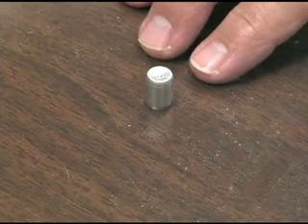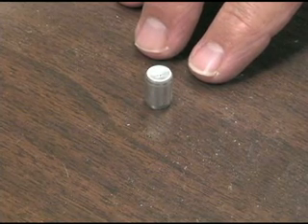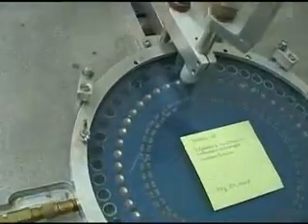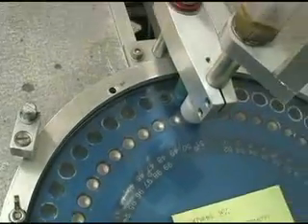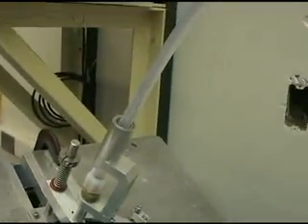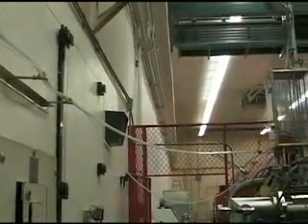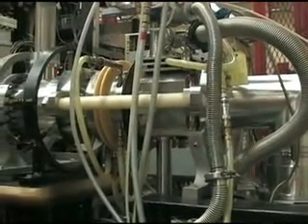We have now pounded the Beryllium-10 — the radioisotope made by cosmic rays — and the Beryllium-9, which we added to the solution before dissolving the quartz, into the cathode. Our goal is to measure the Beryllium-10 to Beryllium-9 ratio. To do that, we use a technique called accelerator mass spectrometry. The ion source is where we get the sample out of the cathode.